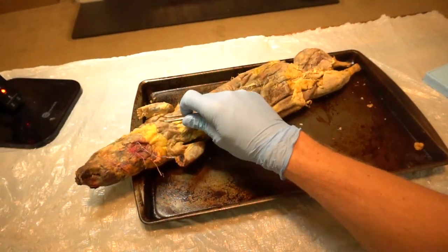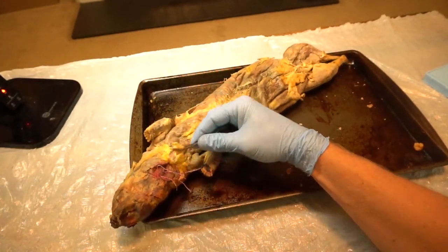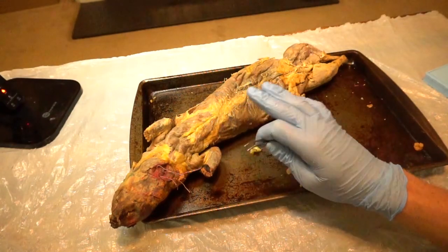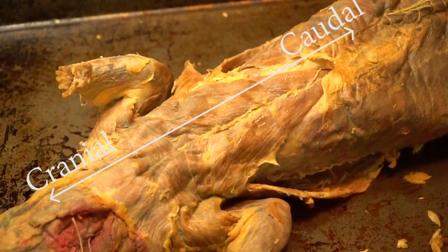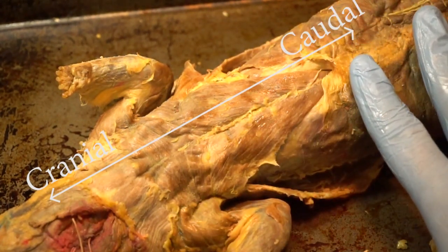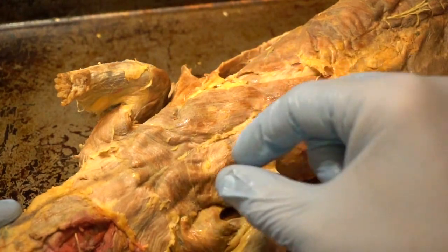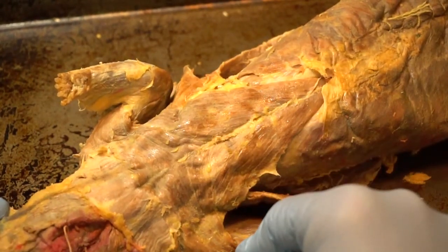I'm going to clean up this mink — I'll pause the video while I do that. Once cleaned up, I've gotten most of the superficial thoracic cleared and I haven't cut yet because I want to show you the borders. There are going to be 1, 2, 3, and then a very thin muscle on top of 3 — so 4 muscles total that you need to find the borders of.